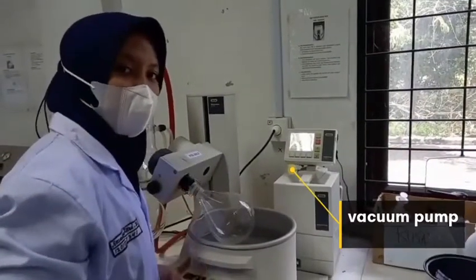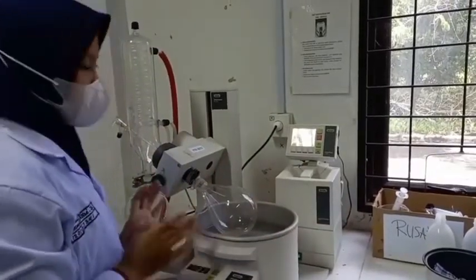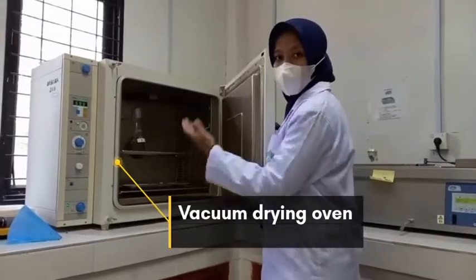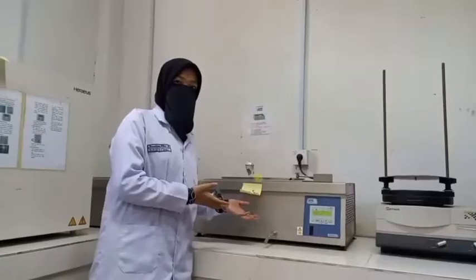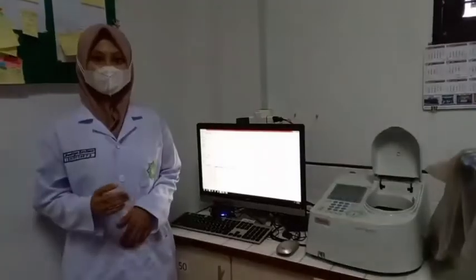Vacuum pump is used to condition the vacuum in the sample by lowering the absolute pressure. Vacuum oven is an appliance that heats or dries, usually used to dry laboratory glassware, chemicals, and organic solvents. Water bath is used for conditioning samples.